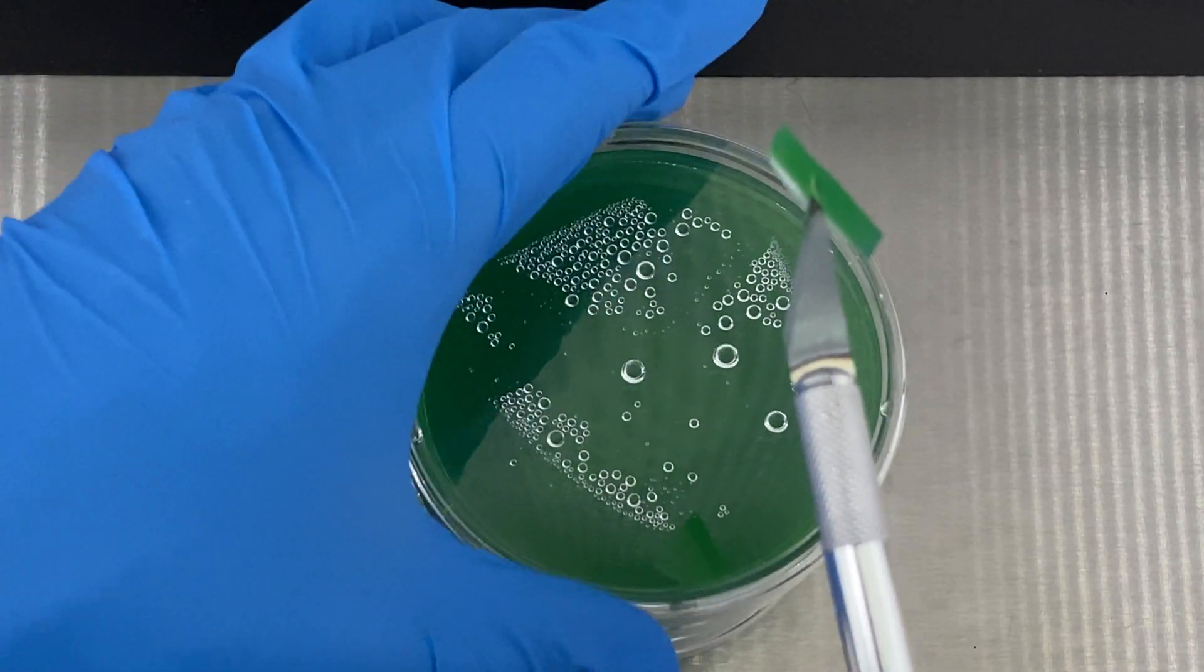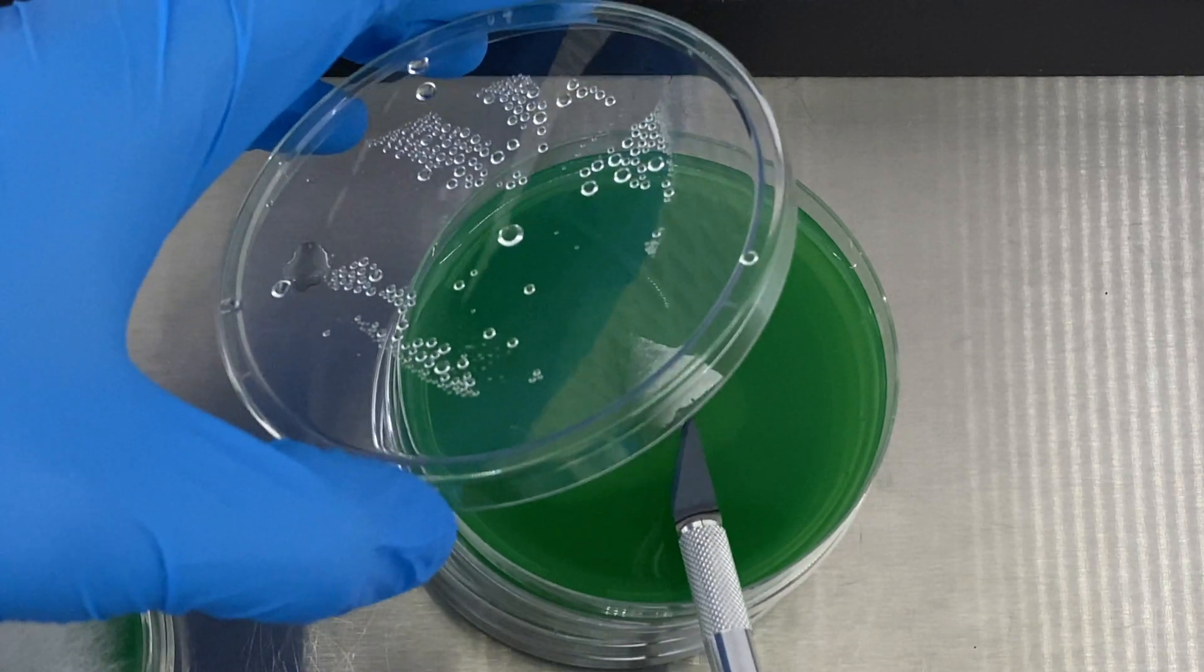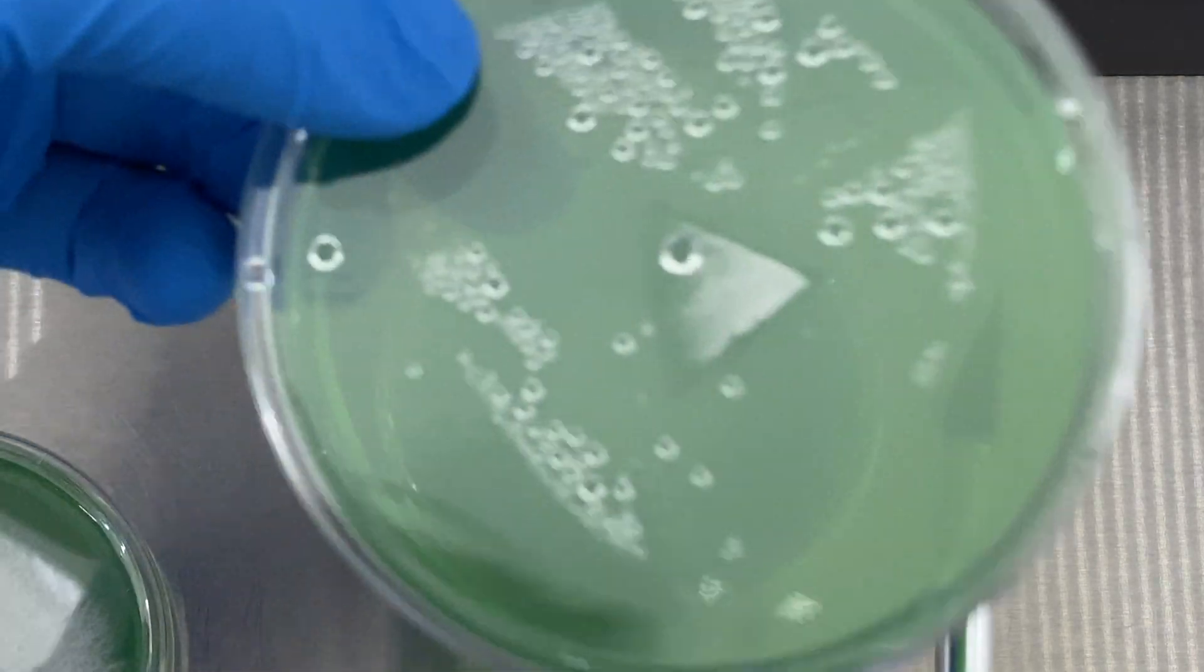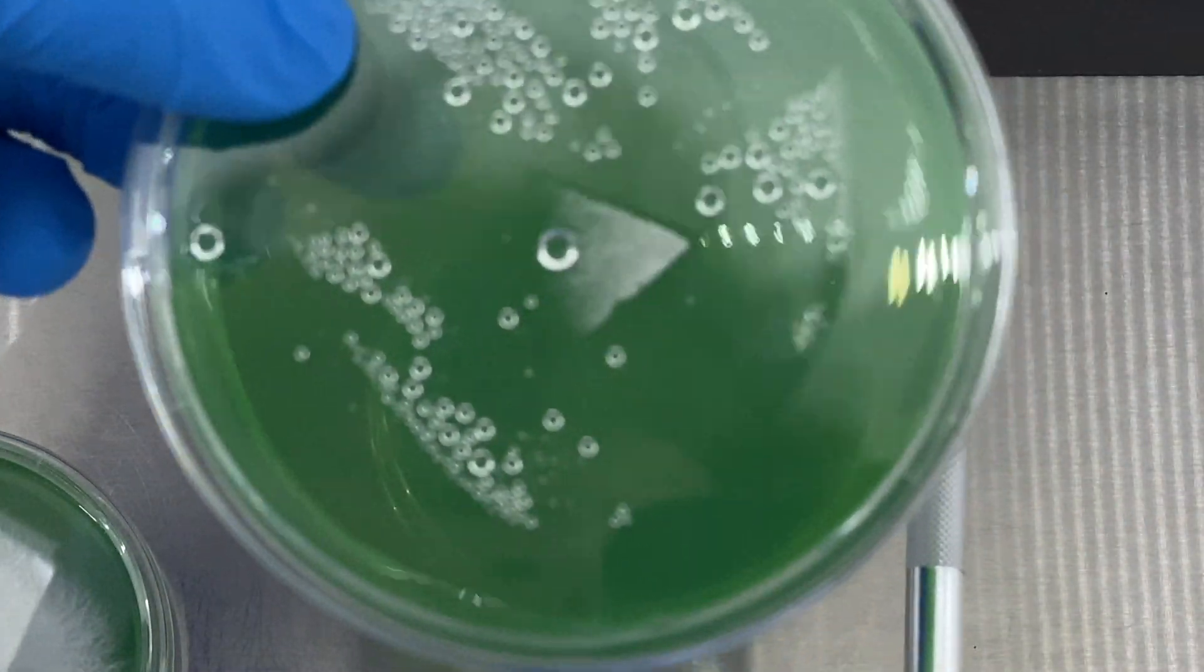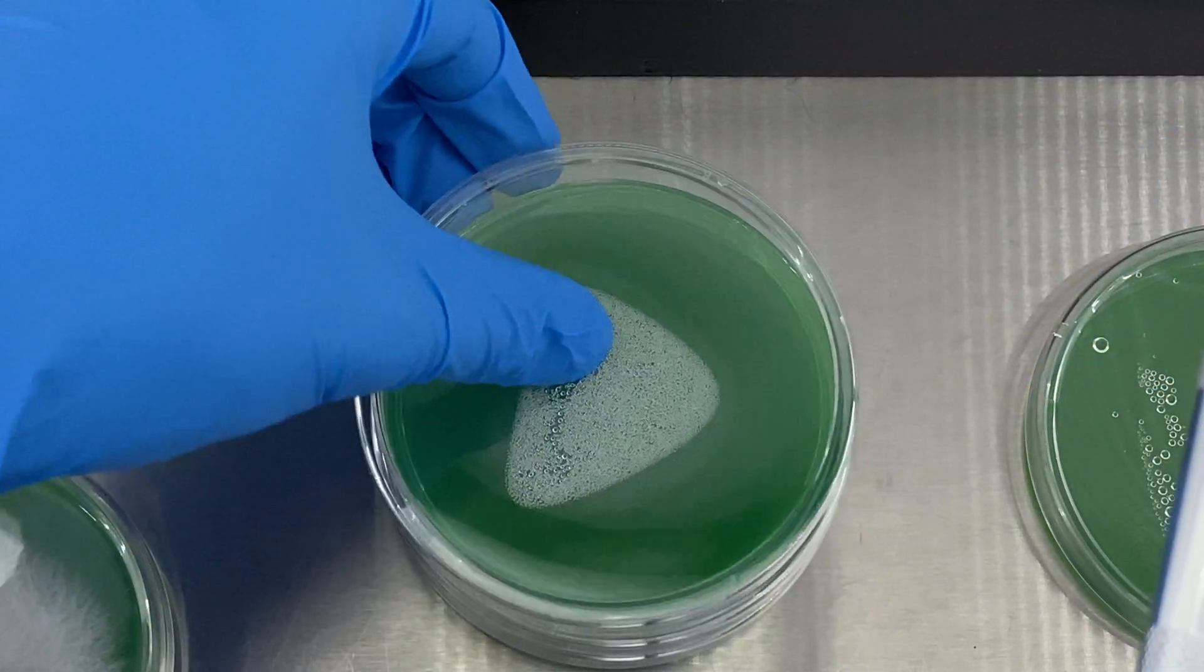Now you see I nicked it a little bit with the edge of the plate but that is no problem, and I want to place it again in the middle of the next plate. All the condensation that you see there should not give any problems to the growth of the culture and that eventually will disappear.